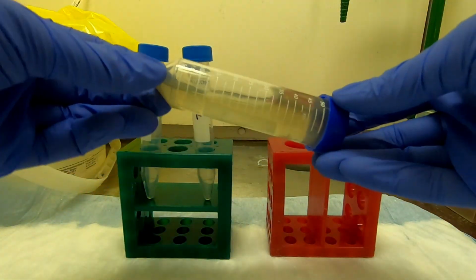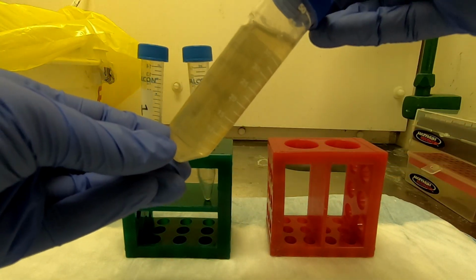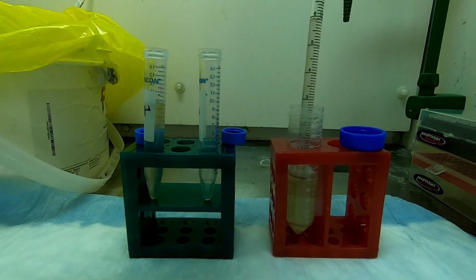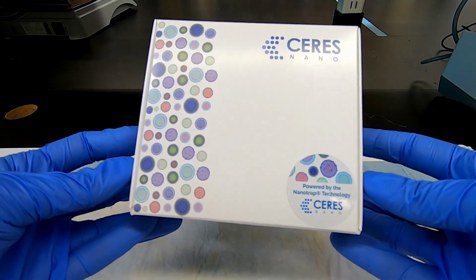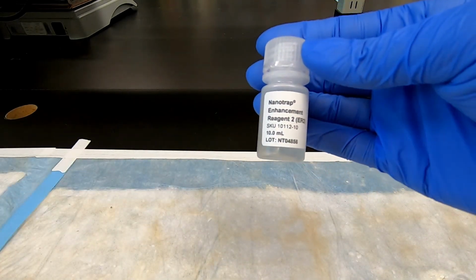This is an influent sample. It is a liquid sample with trace amounts of solid material and is taken from the main inflow of the wastewater treatment plant. Start by transferring some influent to a new tube. This can be scaled up or down accordingly. Magnetic bead technology is used to both concentrate and extract viral RNA from the sample.